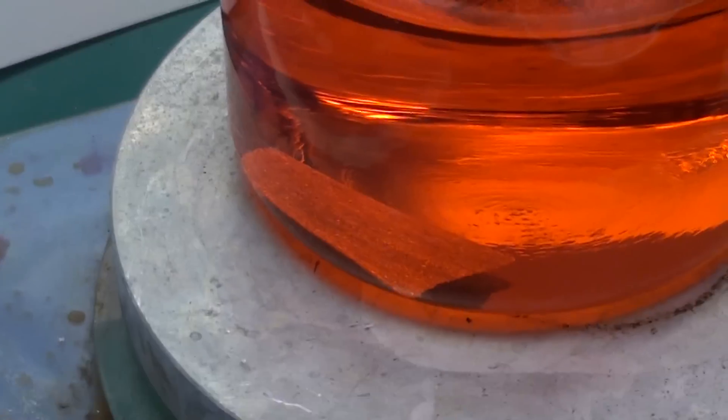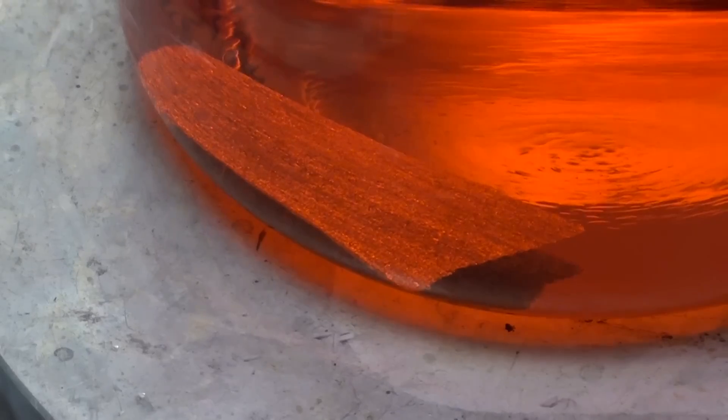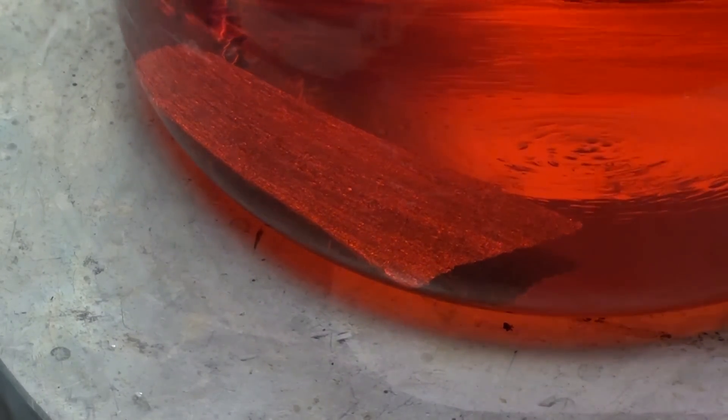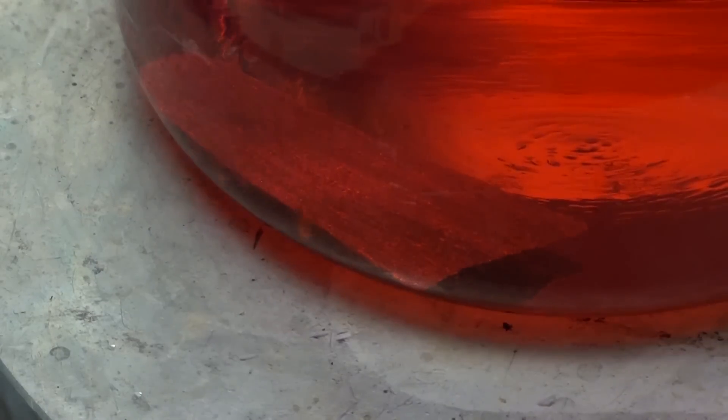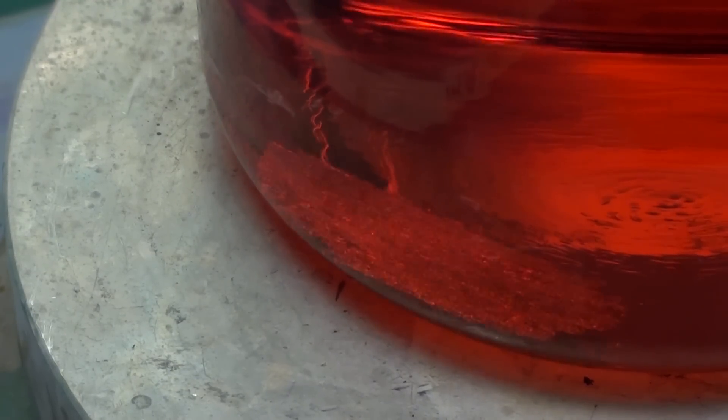Okay, here we are on the third day, let me readjust the camera to get a better look at the platinum. I'm turning the heat back on and adding in another 25 milliliters of nitric acid. I'm also adding 50 milliliters of hydrochloric acid to replenish what was undoubtedly consumed in side reactions occurring in these past few days. There it goes again.